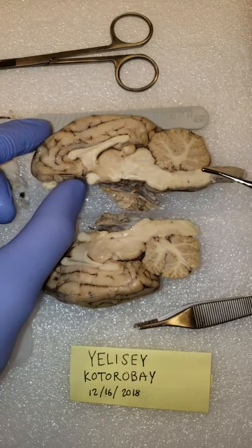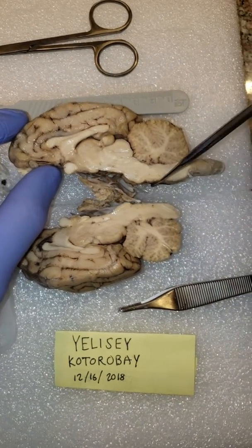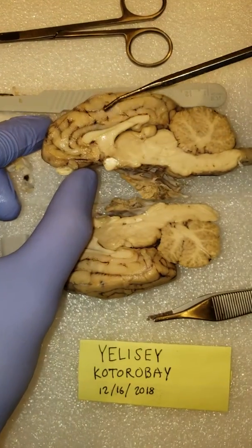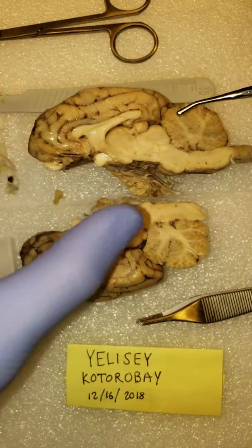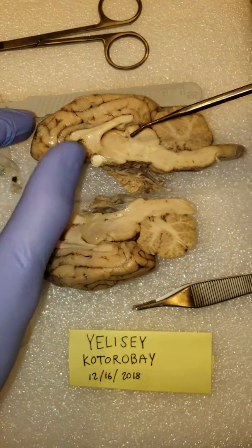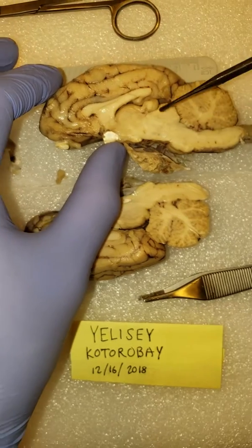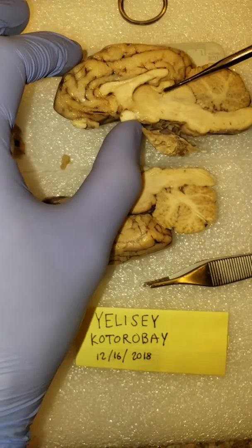What else? We've got the brain stem, the medulla oblongata. We've got the pons. We've got the midbrain region. We've got the frontal lobes, the parietal lobes. We can't really see the temporal lobes from this angle, but that's completely okay. What else? The thalamus. The thalamus and the hypothalamus are basically, well, they're next to your midbrain.